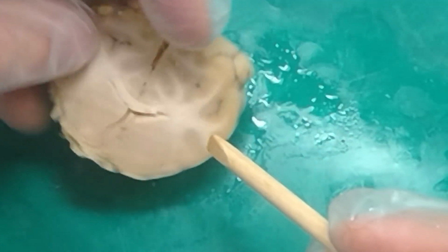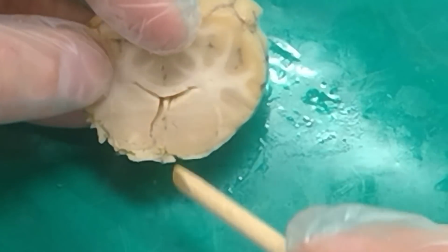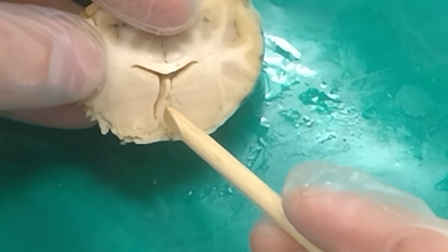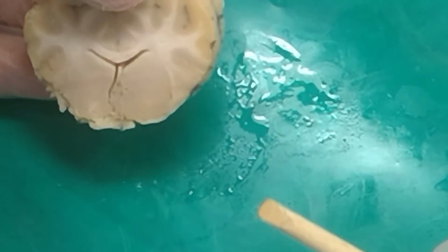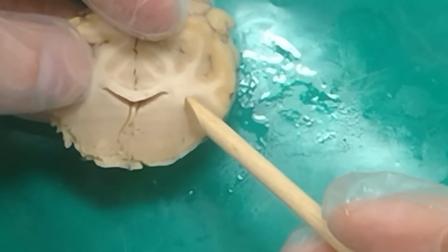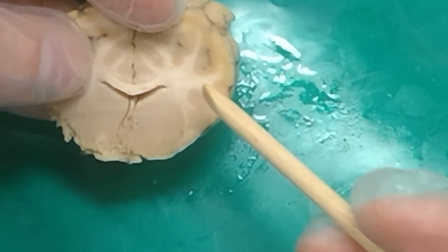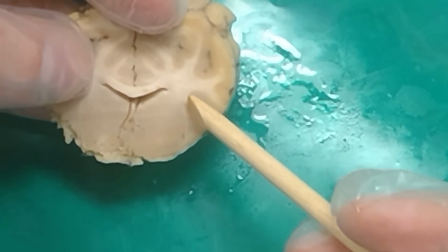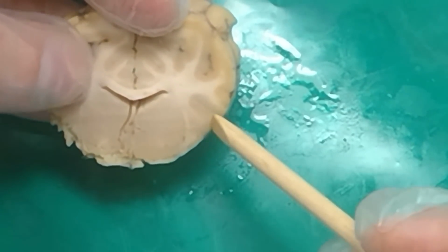So then we've still got that membrane here that's separating the two ventricles. Septum pellucidum. And then we've got this part right here. You can see it separates from the caudate, this septum, right. And then over here, this white fiber bundle on this side of the putamen. External capsule. And then this other white fiber bundle here. Extreme capsule. And then we've got this triangle shape right here. Claustrum. Okay.